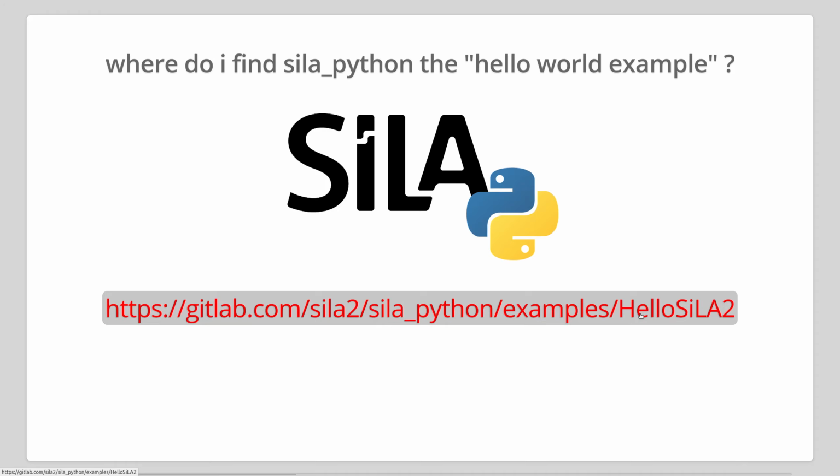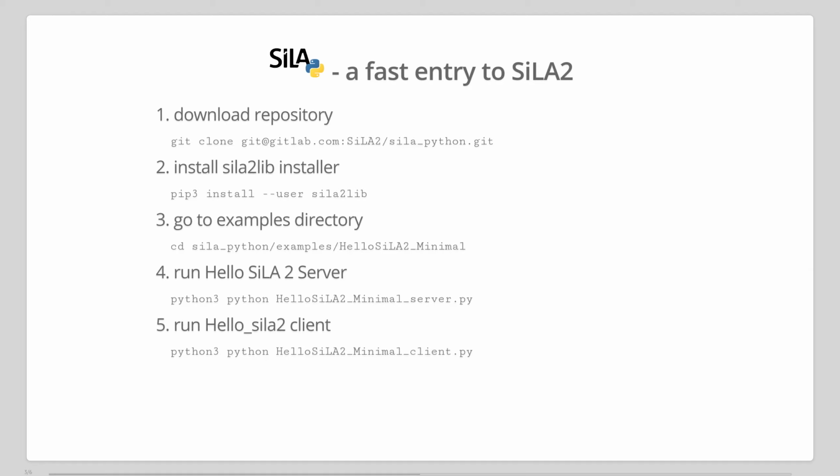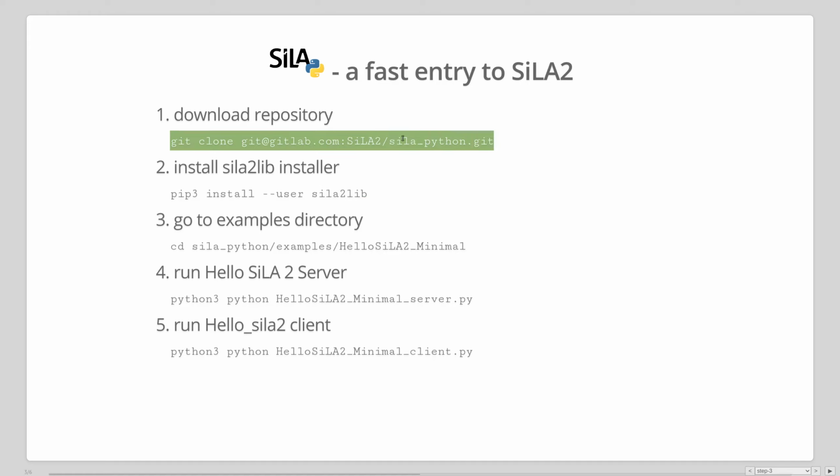But before we go into this example, I would like to go through the workflow, just so that you have an idea what's happening. So we will clone the repository. We will then install one required library that is necessary to run everything. And then we go into the example, run the server and run the client and see what happens. So let's go into that. So I will clone the repository.